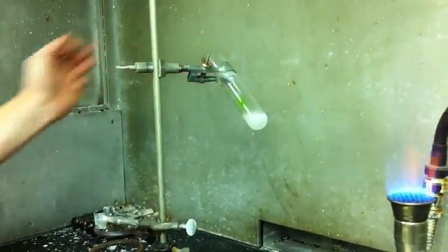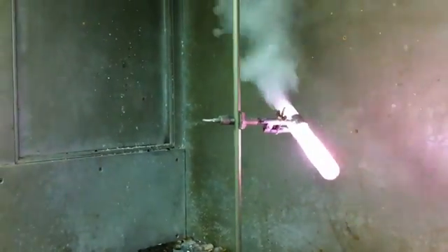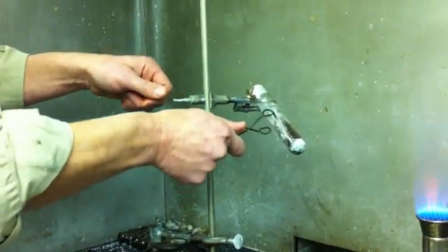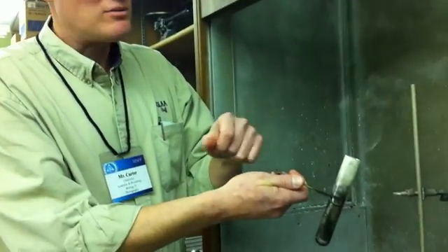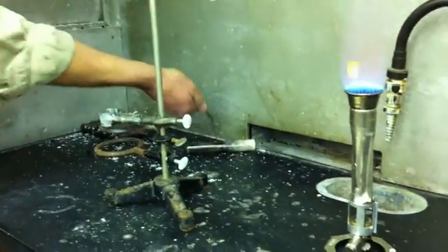Oh, my goodness! Now, what do you notice about the color that the potassium gives to this reaction? Isn't that pretty? Can you smell the excellent smells? I'm sorry if you didn't get a chance to enjoy that smell. What's this white stuff here at the top? — Chloride. It has potassium chloride. Absolutely. So this is the stuff that's kind of similar to table salt. It reacted and got blown up to here. I don't know if it sublimes or how it goes exactly.